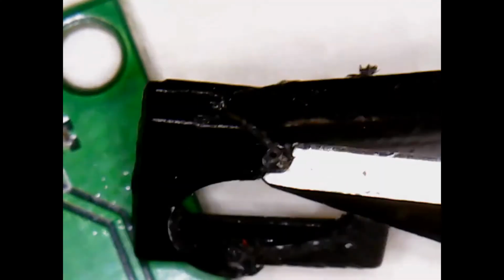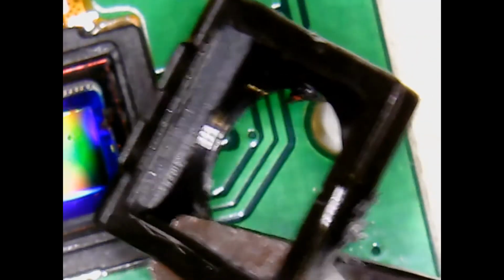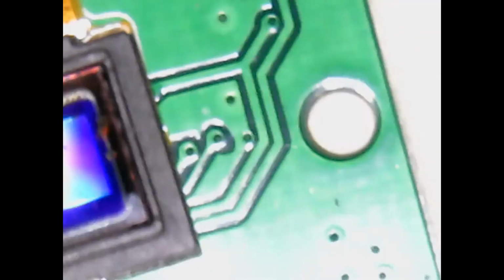Nope, see, it's loose, and it just wants to come off. See that whole top part? I never chewed below it. See, all my chews, I'm going to pull it out here. All the chews are done on the top half.